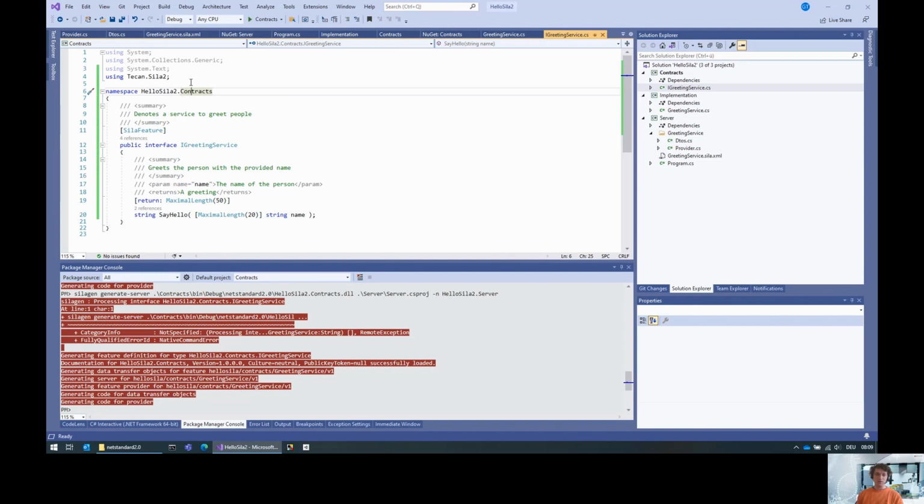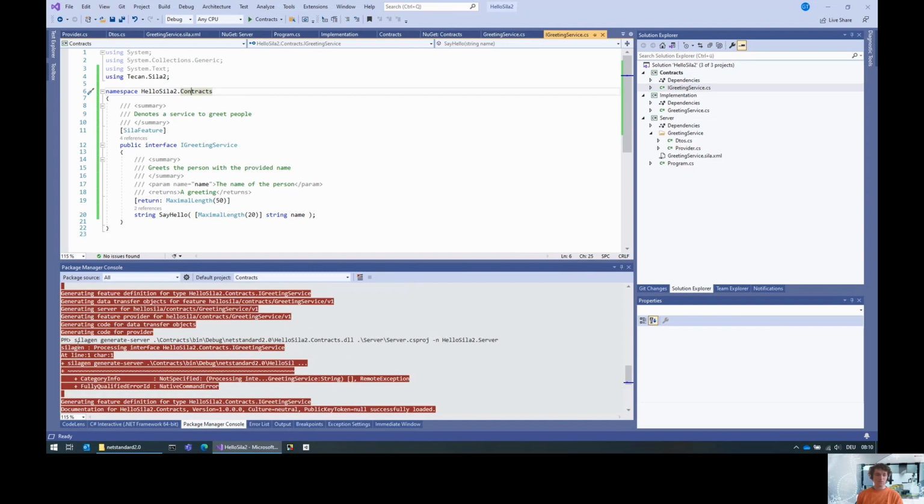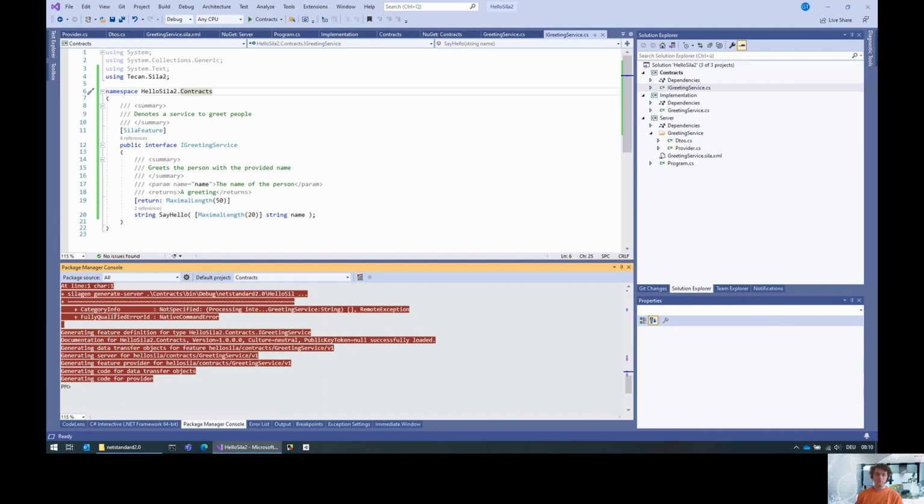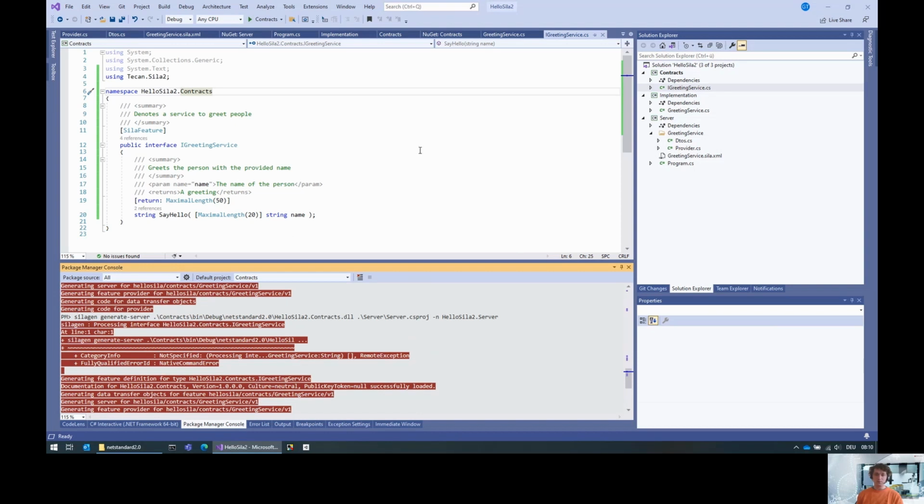If you want to, and I would strongly recommend you to, override this using specific options to the generate server command. And because this generate server command can be quite longish, I would also recommend you to create some sort of batch file or put that into some after-build post-processing step of the contracts package to always regenerate the feature and the commands. Because it's basically super useful. In the scope of this demo, I will always just re-execute this line here. But for you, I would strongly recommend to create some sort of batch file.